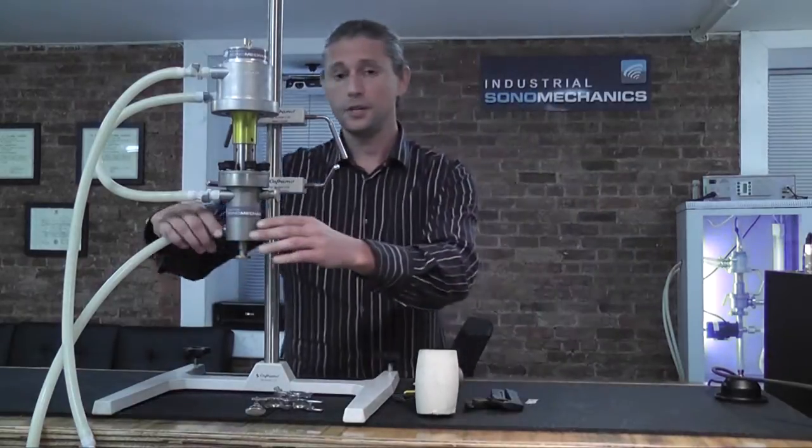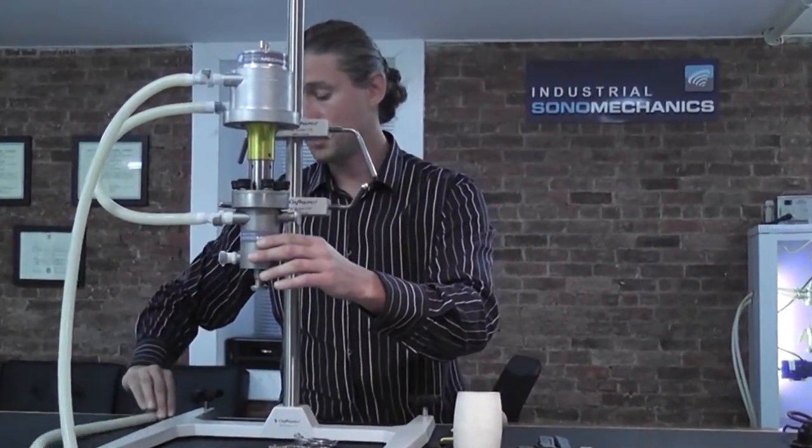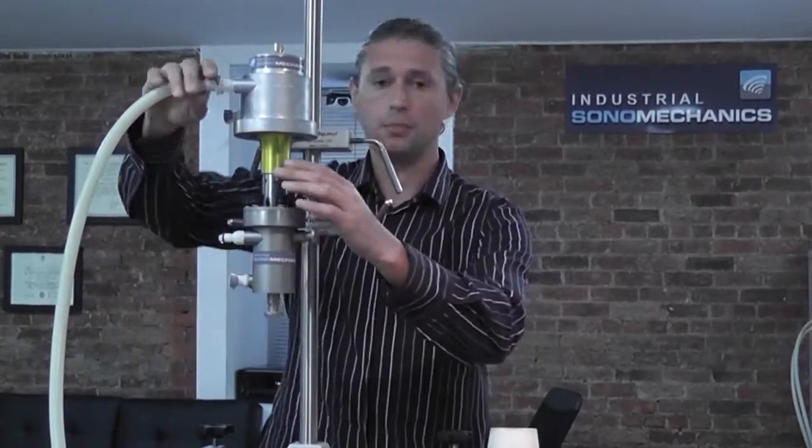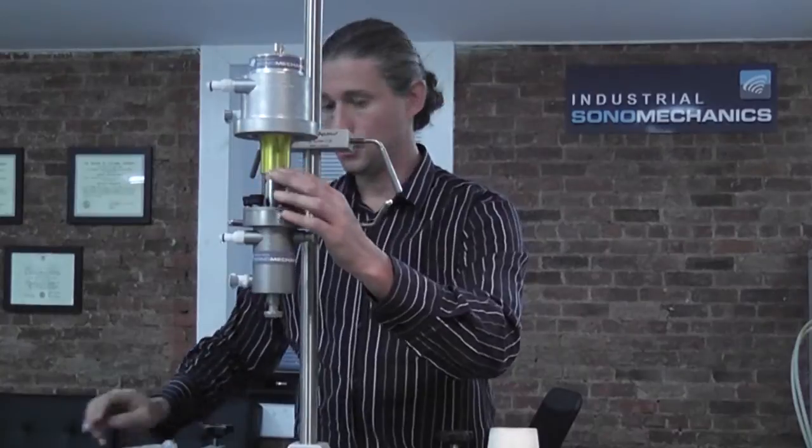The next step is to disconnect the cooling lines. The cooling lines are connected by quick disconnect couplings, which are valved, so you will at most see a few drops of the cooling liquid.